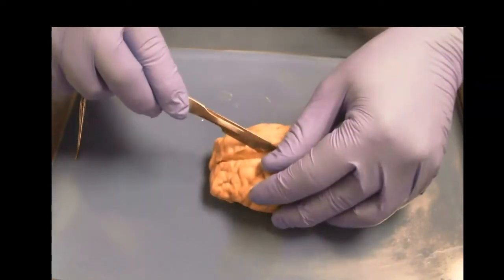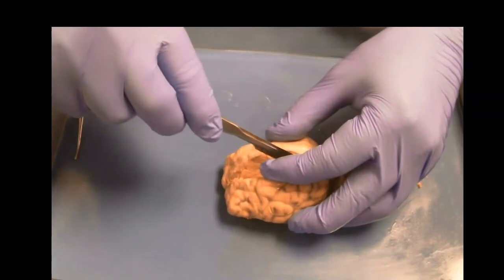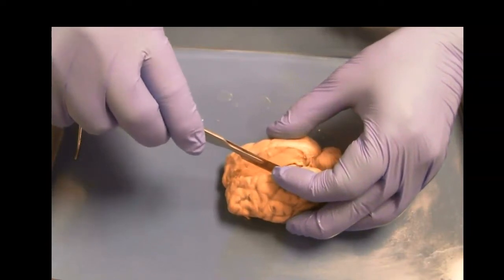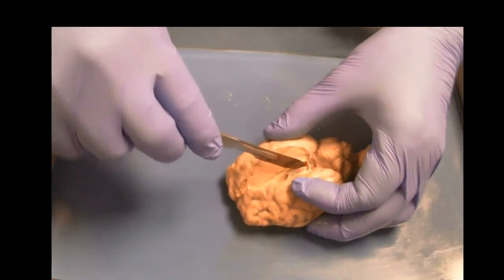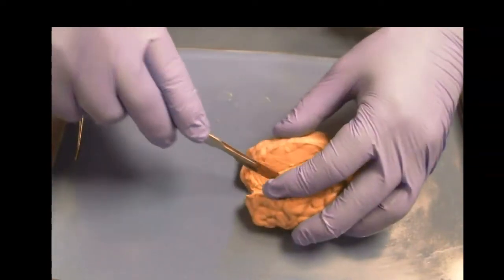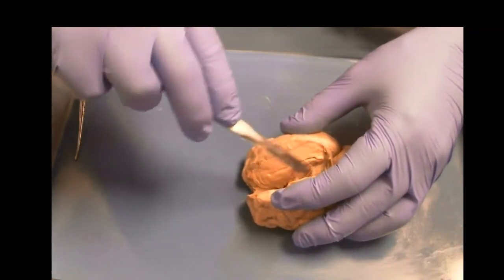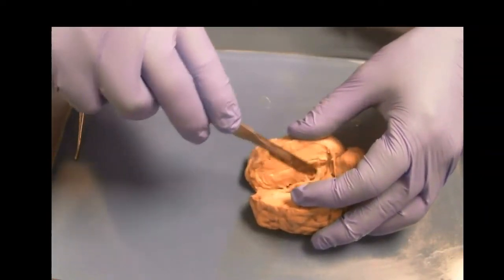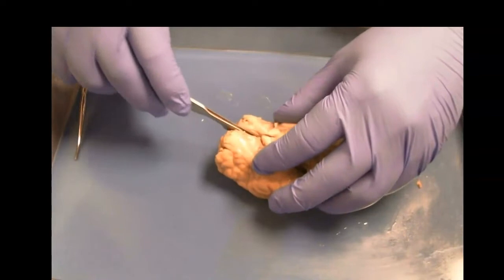nice and carefully. And what we see is that it separates really easily until we get to here, right? Where we have the corpus callosum. And I just severed that. That's this thick band of white matter that's connecting the left and right hemispheres. We're going to continue cutting pretty much midline through here to separate the left and right hemispheres. We can see there's some blood vessels here, nothing we're particularly concerned with. Looks like the pineal gland back here. See this little bump right here, that should be it. There's only one; a lot of the brain structures are mirrored, but there's only one pineal gland.